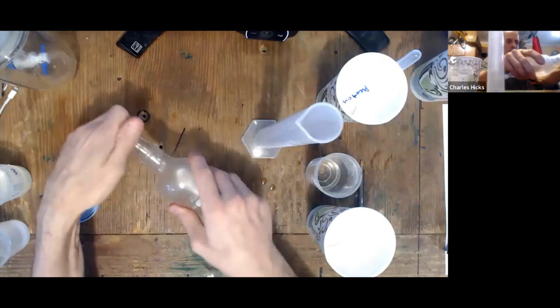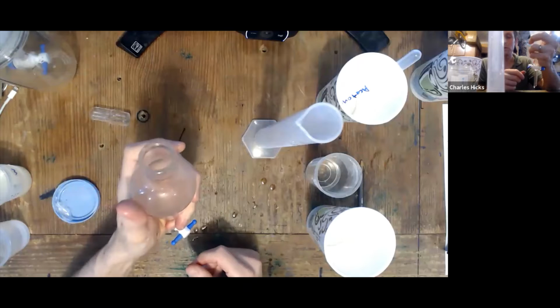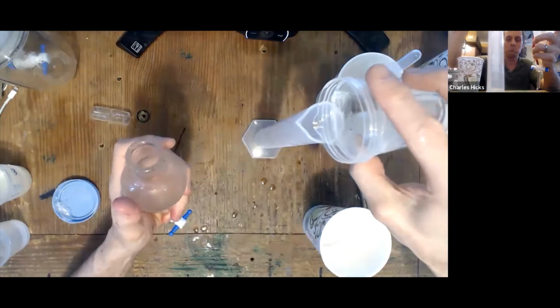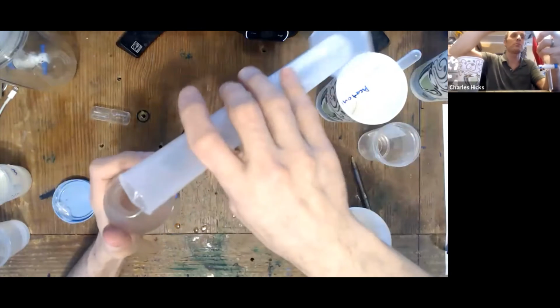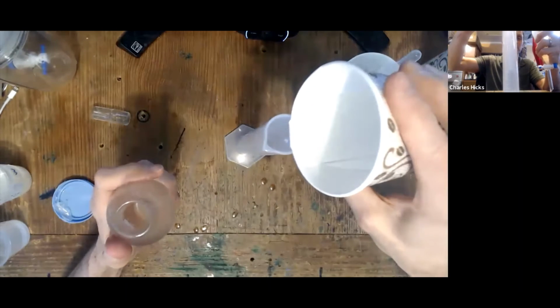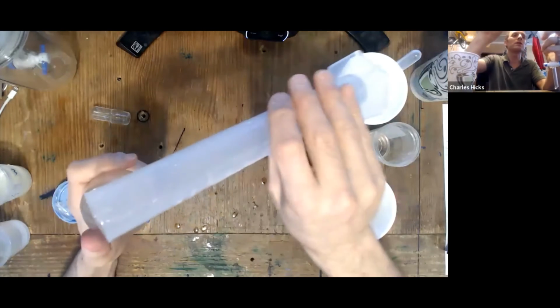Okay, so for this equilibrated mixture, we need to make sure the stopcock is closed, certainly. We want to measure about 15 mLs of the canola oil. Put that in the separatory funnel. And then we need to measure about 15 mLs of water. That's just about 15.